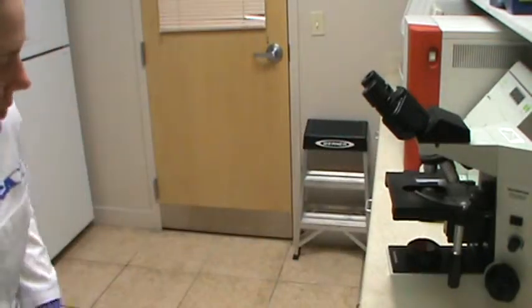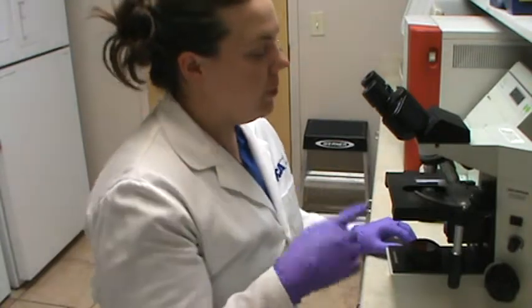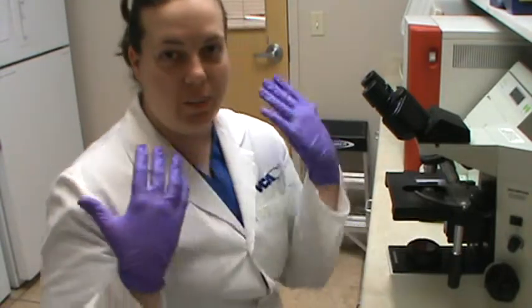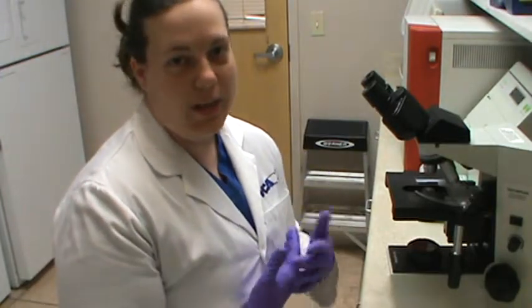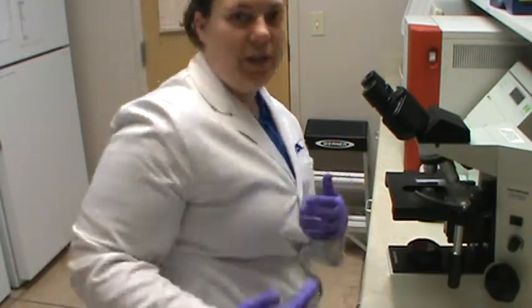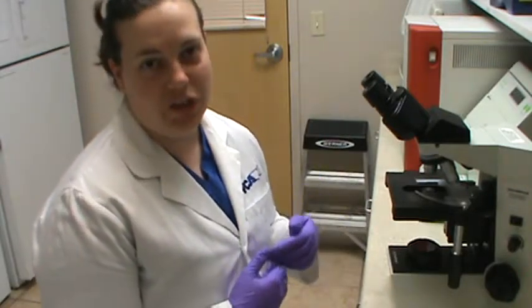Alright, so just to finish up task 14, we're going to take our skin scraping slide that we prepared, put it on our microscope, and just see if we find anything. Generally, we're looking for types of abnormal cells or any bacteria, yeast, any parasites such as scabies or demodex or anything that might be causing this friend to have some itching and hair loss.